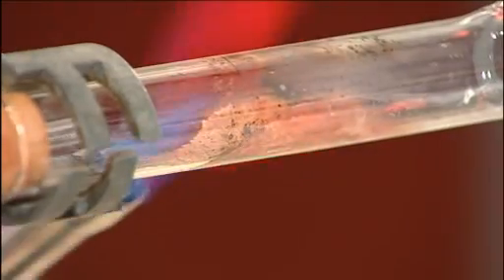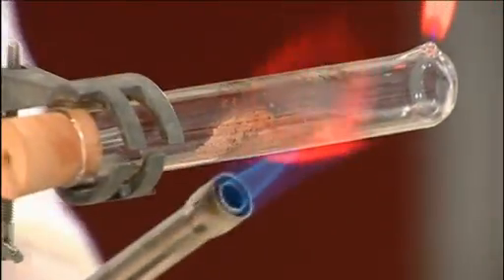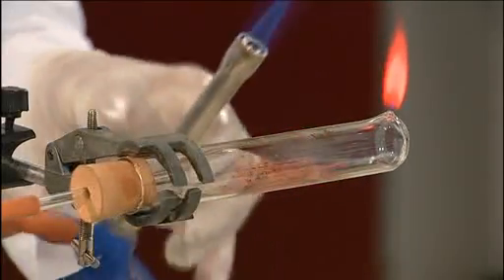If in any doubt, continue heating for longer. Make sure any condensation has evaporated. When you're confident that all the copper oxide has been reduced and the flame is back to its original height, you can stop heating.